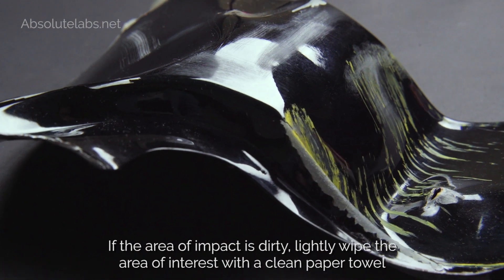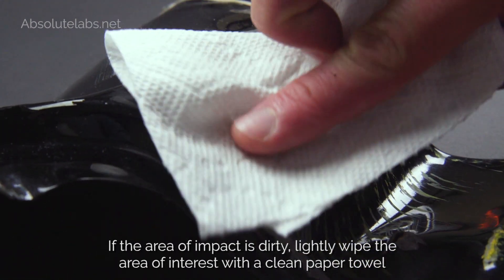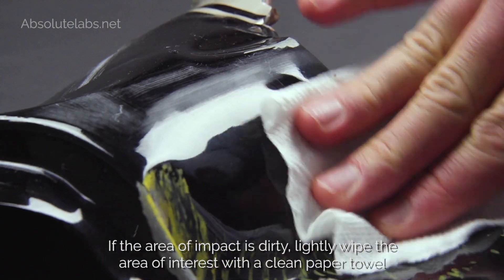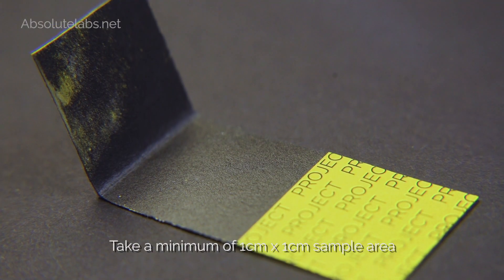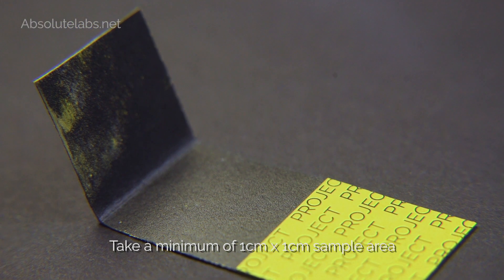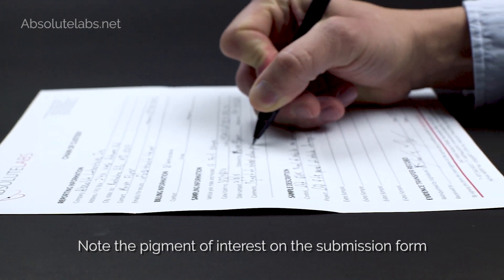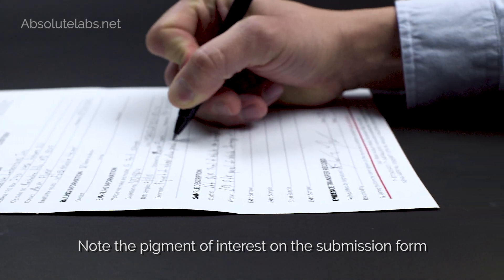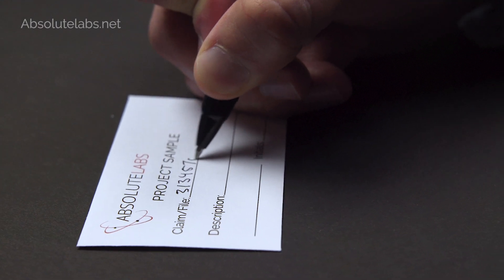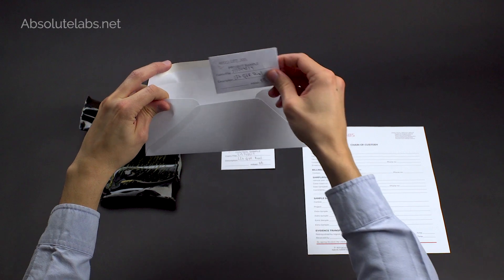If the area of impact is dirty, lightly wipe the area of interest with a clean paper towel. Take a minimum of 1 cm by 1 cm sample area. Note the pigment of interest on the submission form. Fill out and seal the project envelope and place it in the mailing envelope.